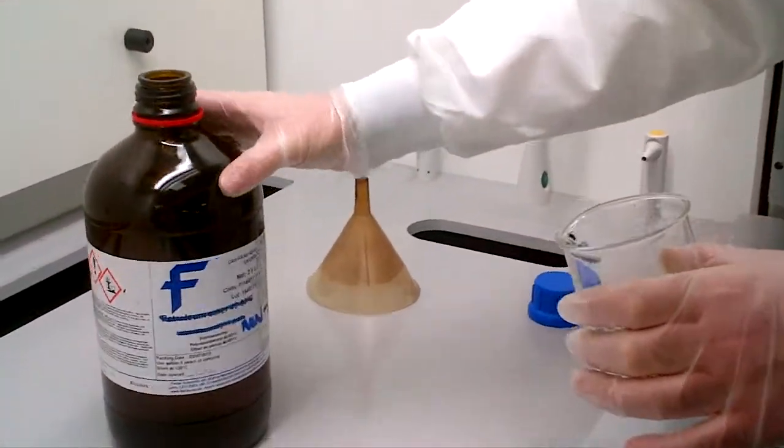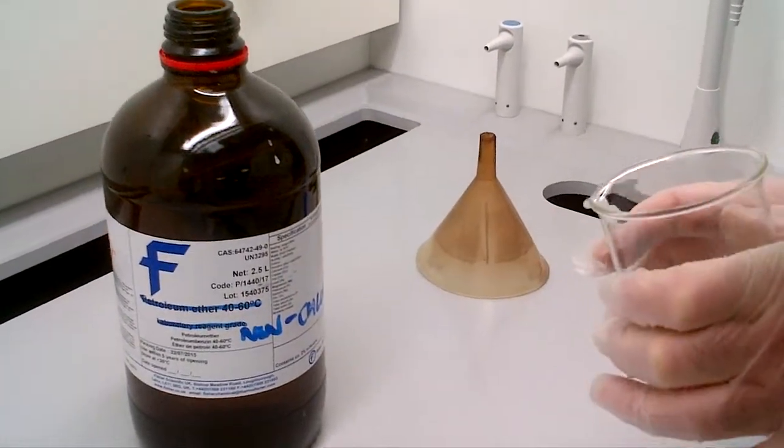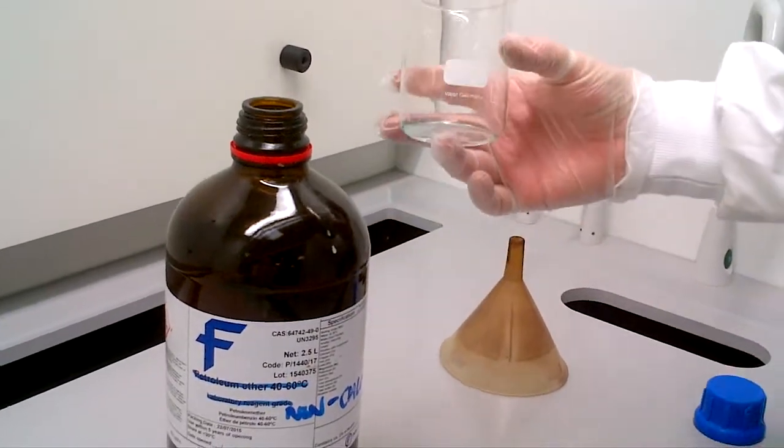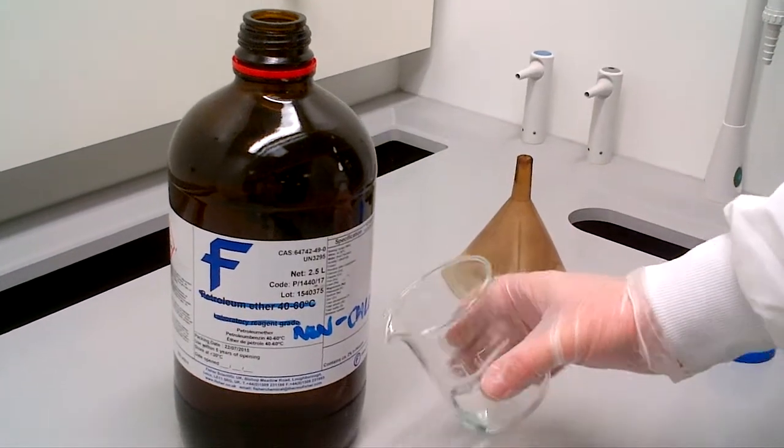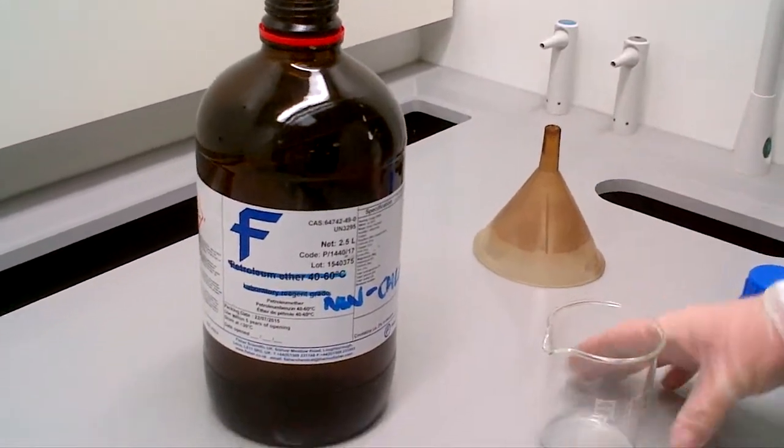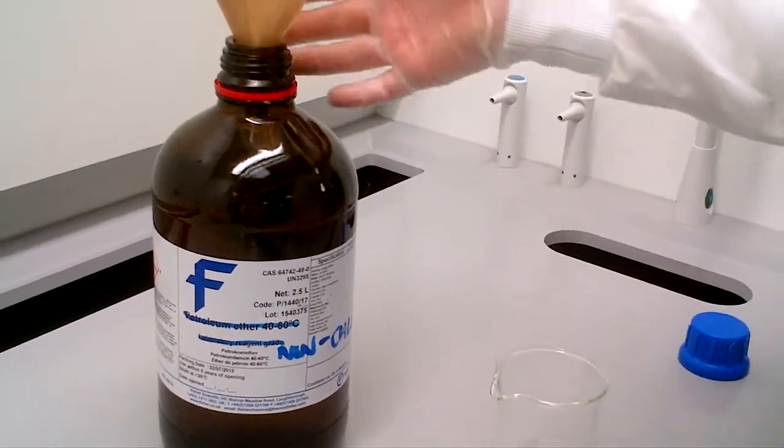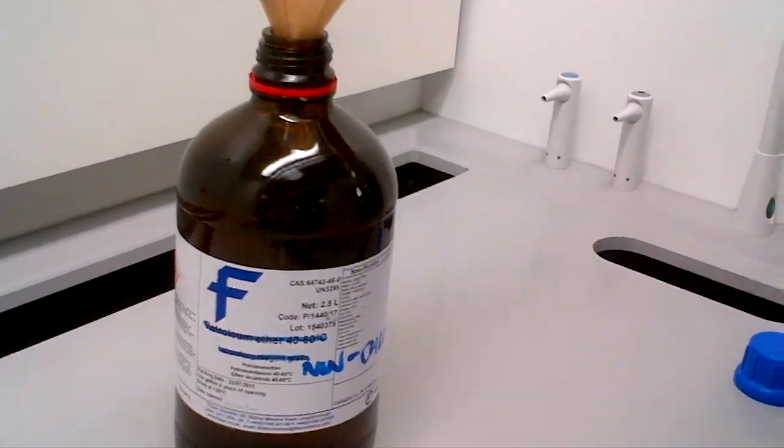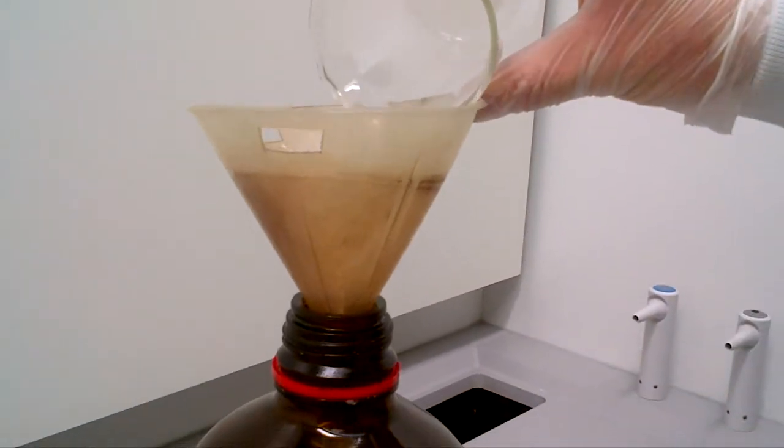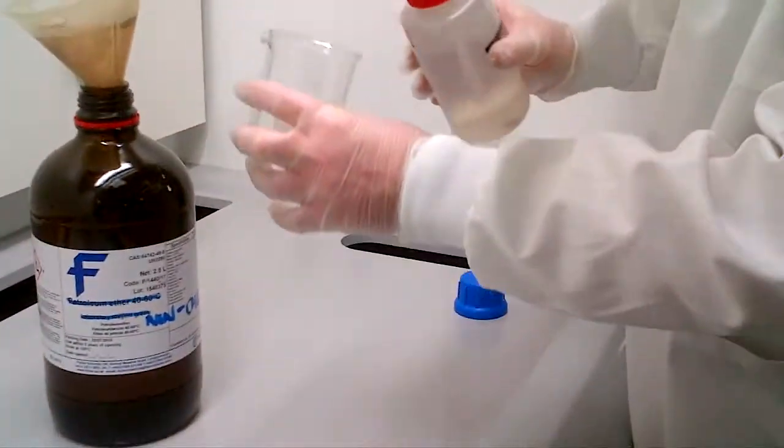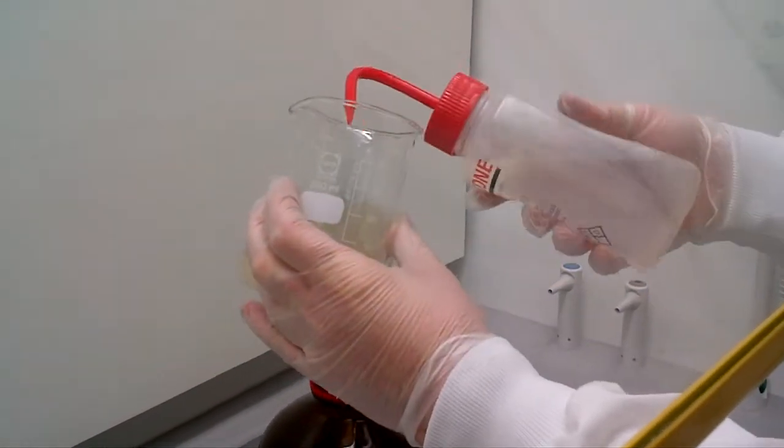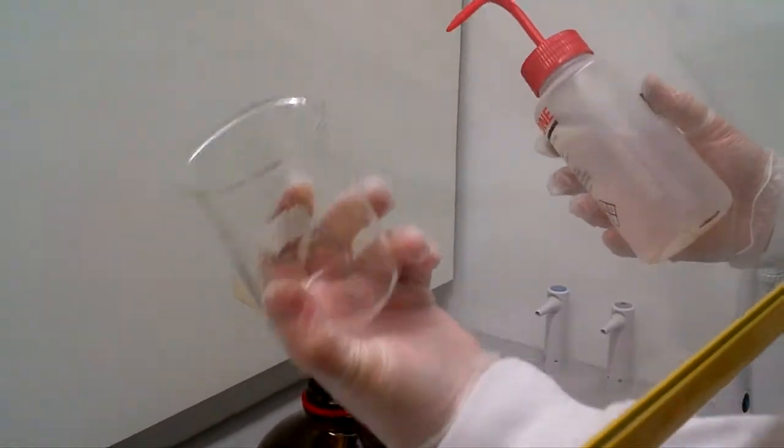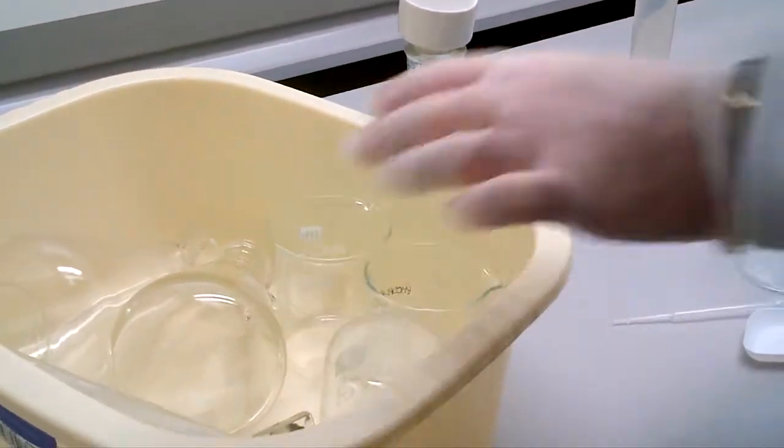How do we get rid of this? Well, in each fume cupboard, you'll have a waste bottle. You can either have non-chlorinated or chlorinated. If it's solvent like chloroform or DCM, it wouldn't go in the non-chlorinated, you would use the chlorinated waste bottle. But we presume, let's say this is something of ethyl washings, ethyl acetate washings, organic waste into here. We would need to just rinse out the inside of the flask. Then you've got a clean-ish beaker, ready to be washed with quadrilene.